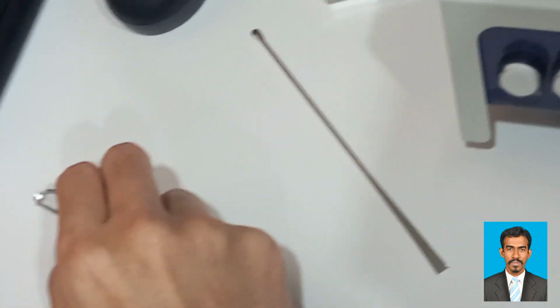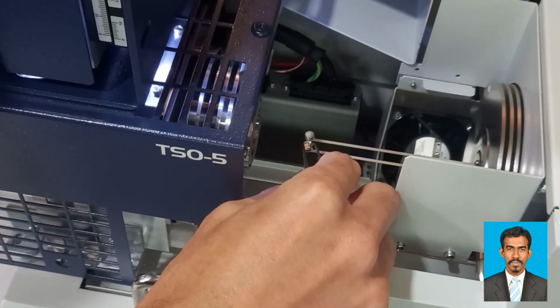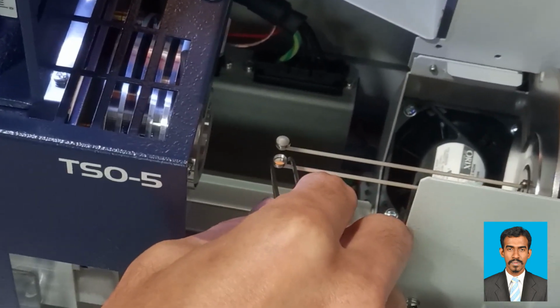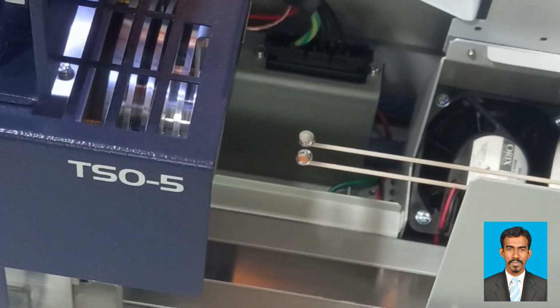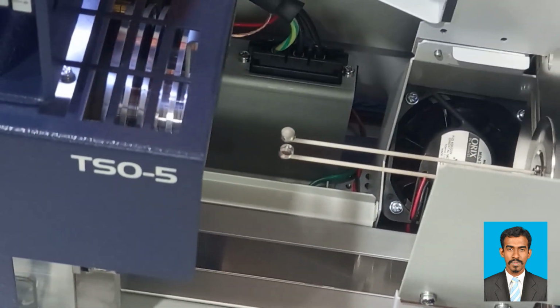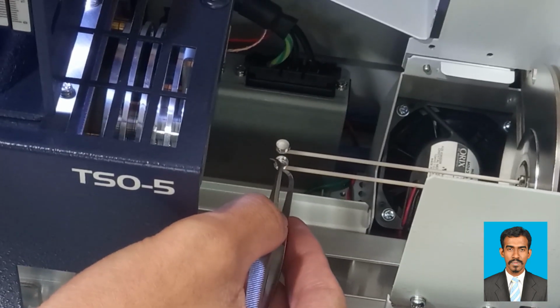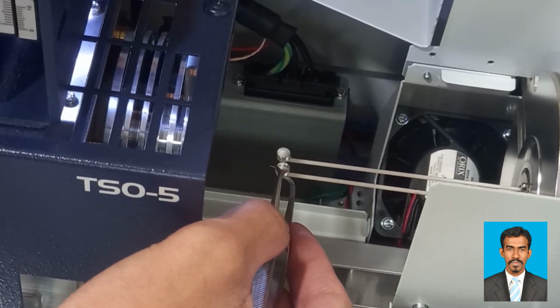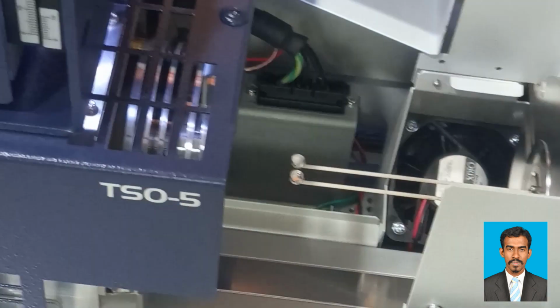Here we have the sample pan and reference pan. The sample to be analyzed is placed in a small sample pan, typically made of a material that does not react with the sample during the analysis, probably aluminium, platinum or ceramic, and in this case it's aluminium. Reference pan: an empty reference pan identical to the sample pan is used to serve as a baseline for the thermal measurements. It ensures that any changes observed in the experimental sample are not due to the instrumentation itself.